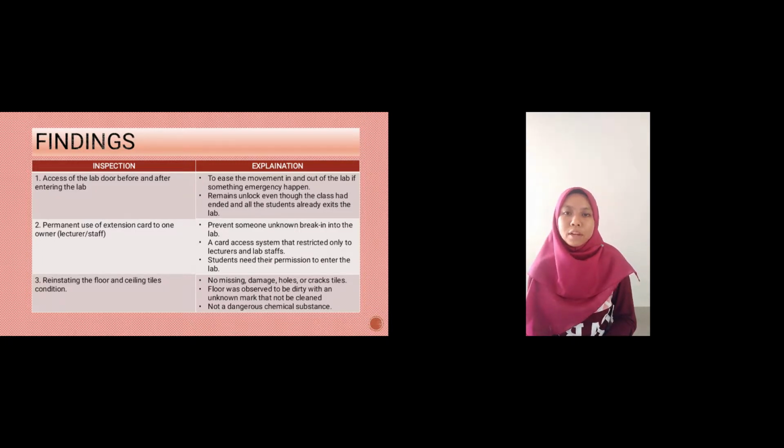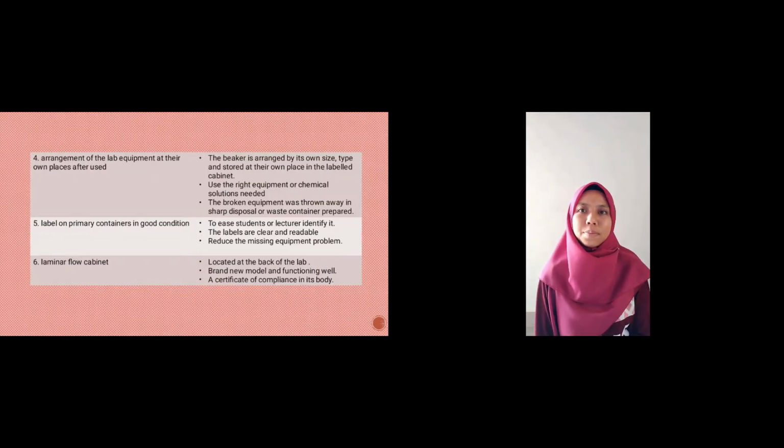The third inspection is reinstating the floor and the ceiling tiles condition. From what we have seen, there are no missing, damaged holes or any cracked tiles. The floor was observed to be dirty with an unknown mark that has not been cleaned. I think it is not a dangerous chemical substance. Fourth inspection is the arrangement of the lab equipment at their own place after being used. The beaker is arranged by its own size, type, and stored at their own place in the labeled cabinet.